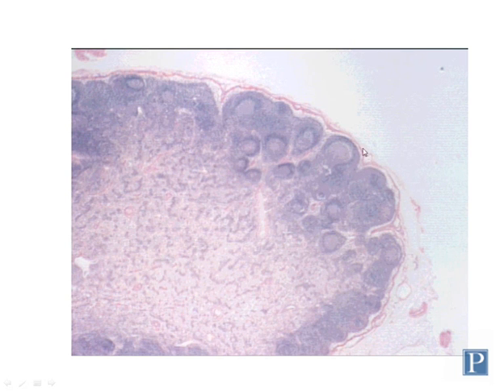And all lymph nodes are encapsulated, and they have a couple of different regions. The outermost region, which is more basophilic and contains many lymphoid nodules, some of them secondary, as you can see here, some of them primary. This outer region that contains the lymphoid nodules is referred to as the cortex of a lymph node.